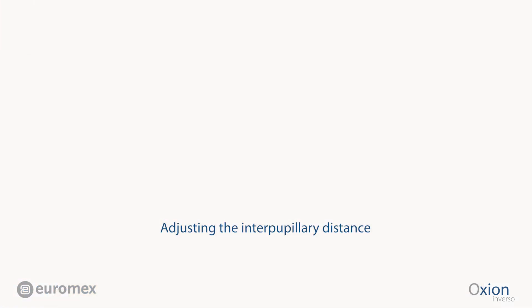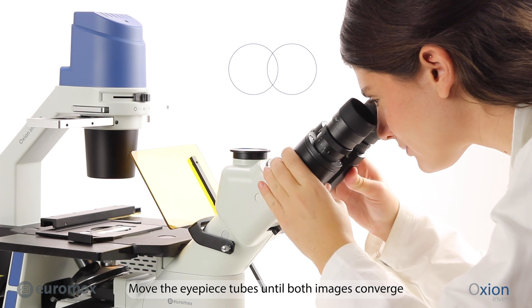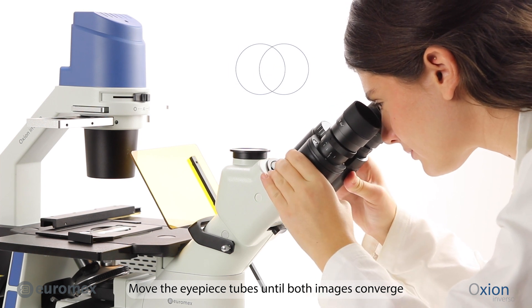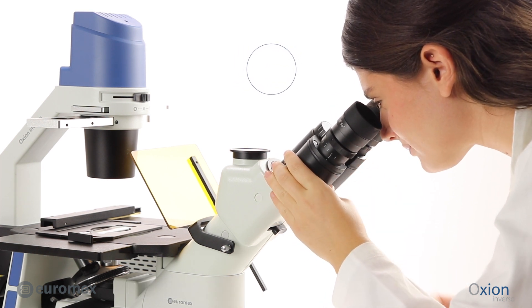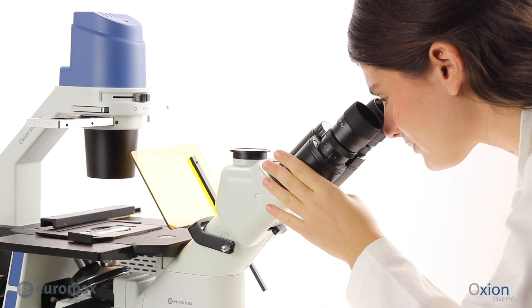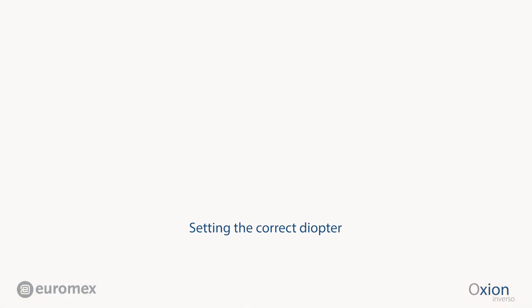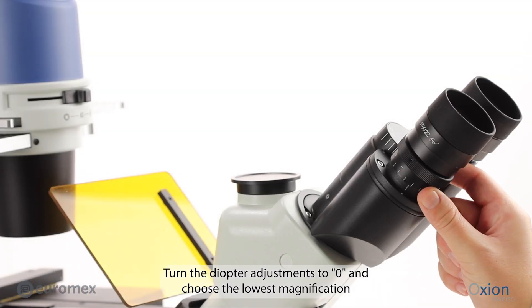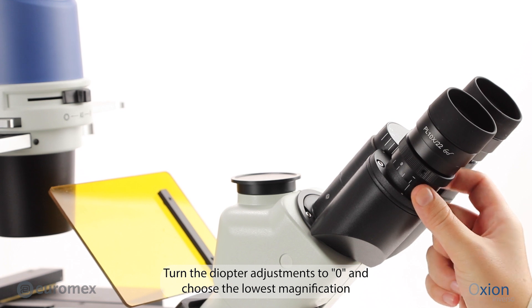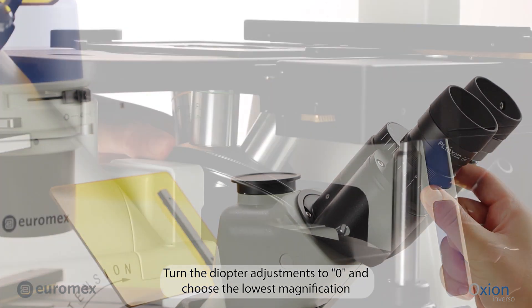Adjusting the Interpupillary Distance. Move the Eyepiece Tubes until both images converge. Setting the Correct Diopter: turn the Diopter Adjustments to 0 and choose the lowest magnification.